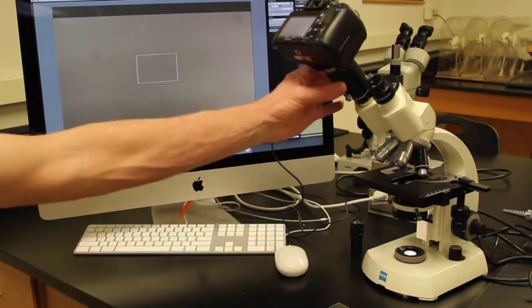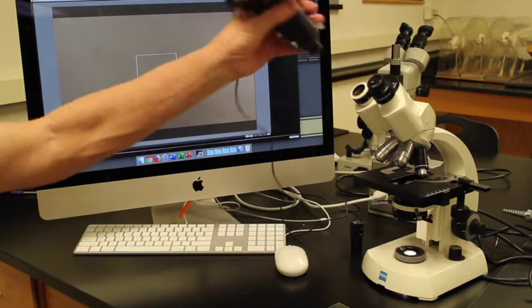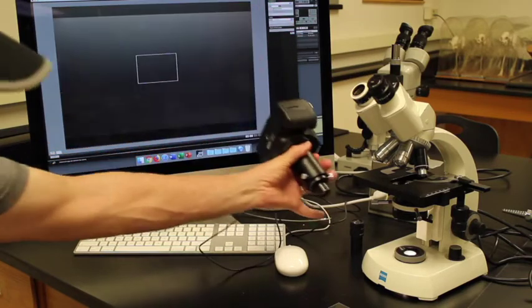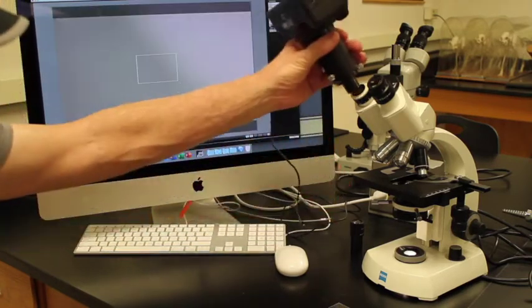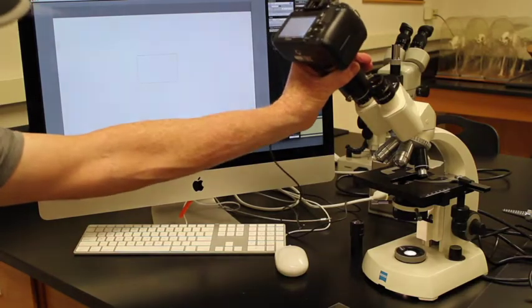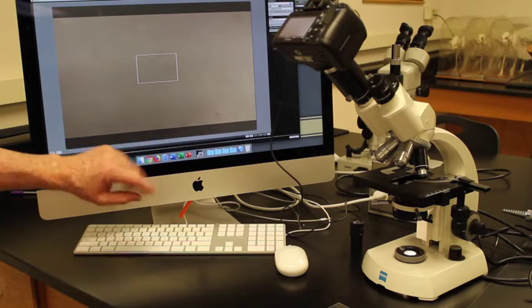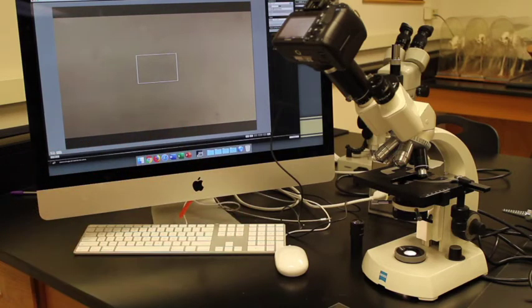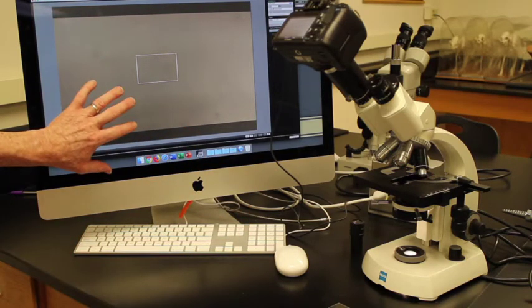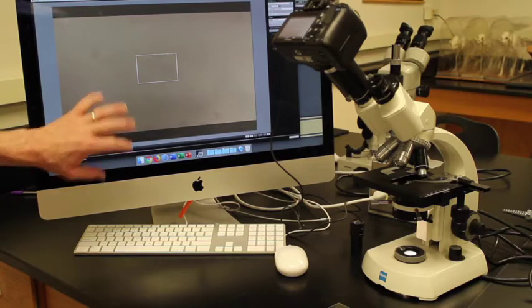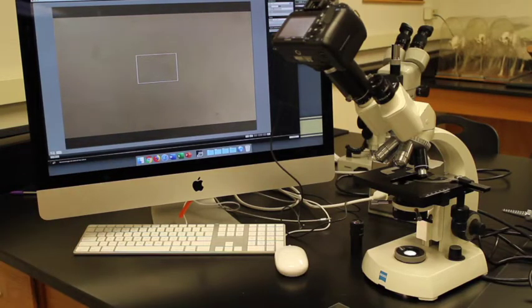Now, we also have a camera attached. This camera goes right into the eyepiece. So we basically take this eyepiece out, put this camera in, and we have it hooked up to a computer. We can get a live image on the computer. So everything that I see in the microscope, you will see on this computer image, and you will get a nice live view of exactly what's going on in the microscope.